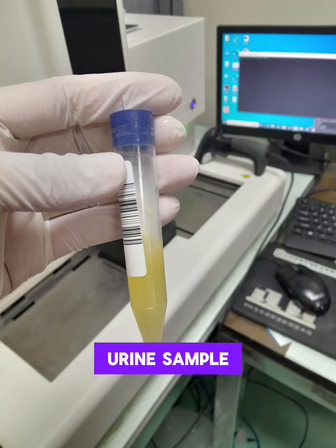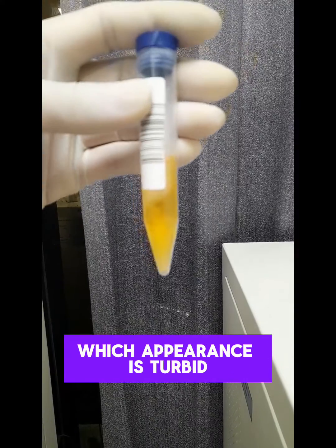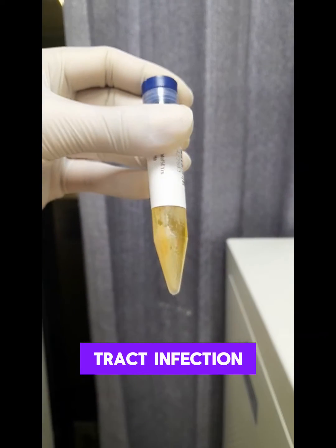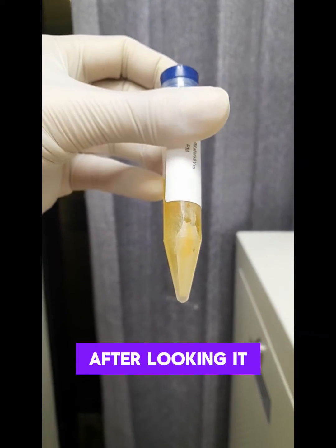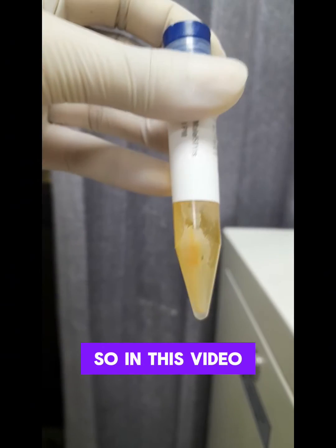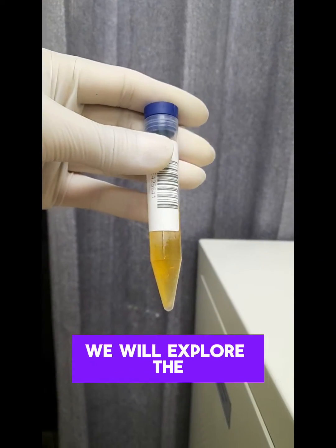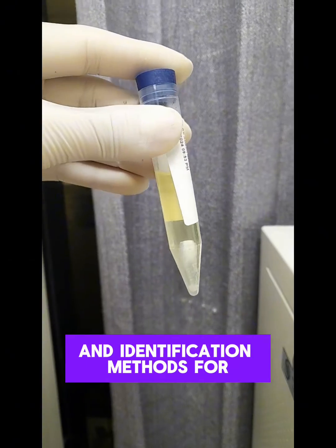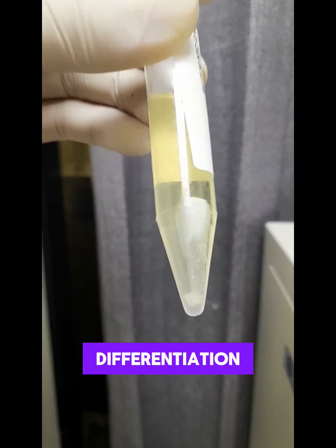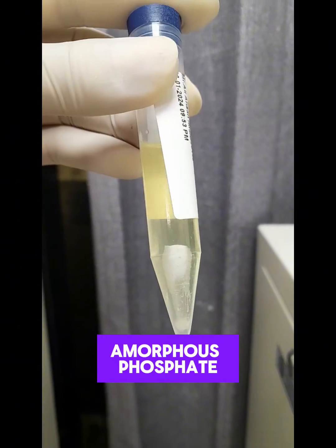This is a patient urine sample, which appearance is turbid. Are you suspecting urinary tract infection after looking at it? If yes, you are wrong this time. In this video, we will explore the characteristics and identification methods for differentiation between amorphous urates and amorphous phosphate.